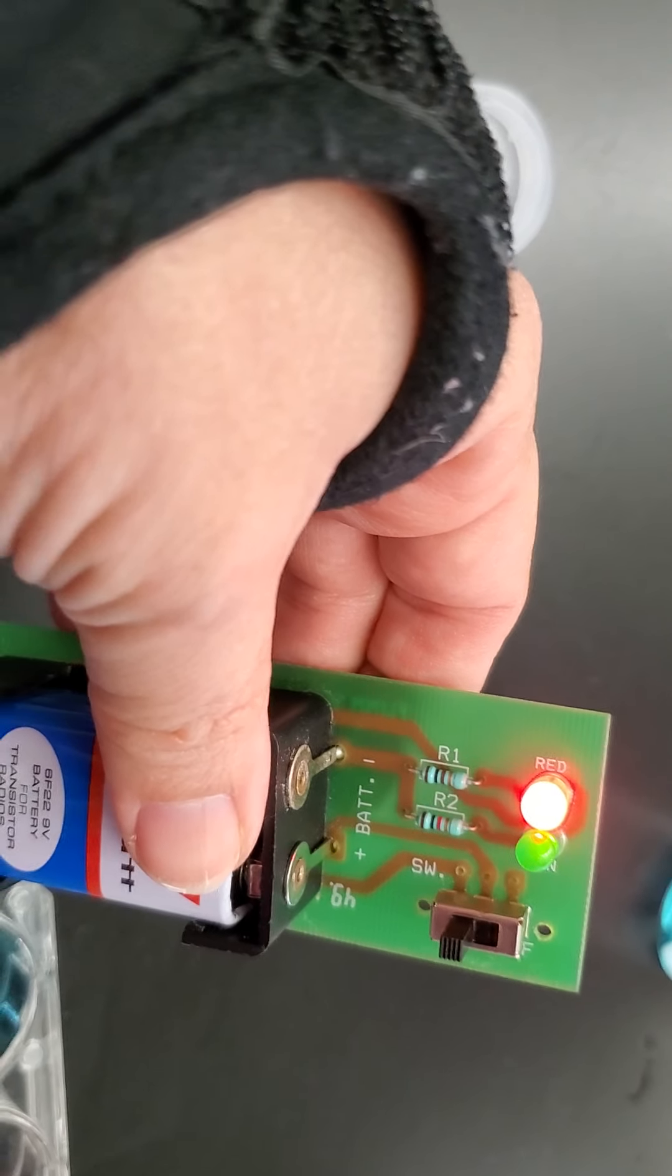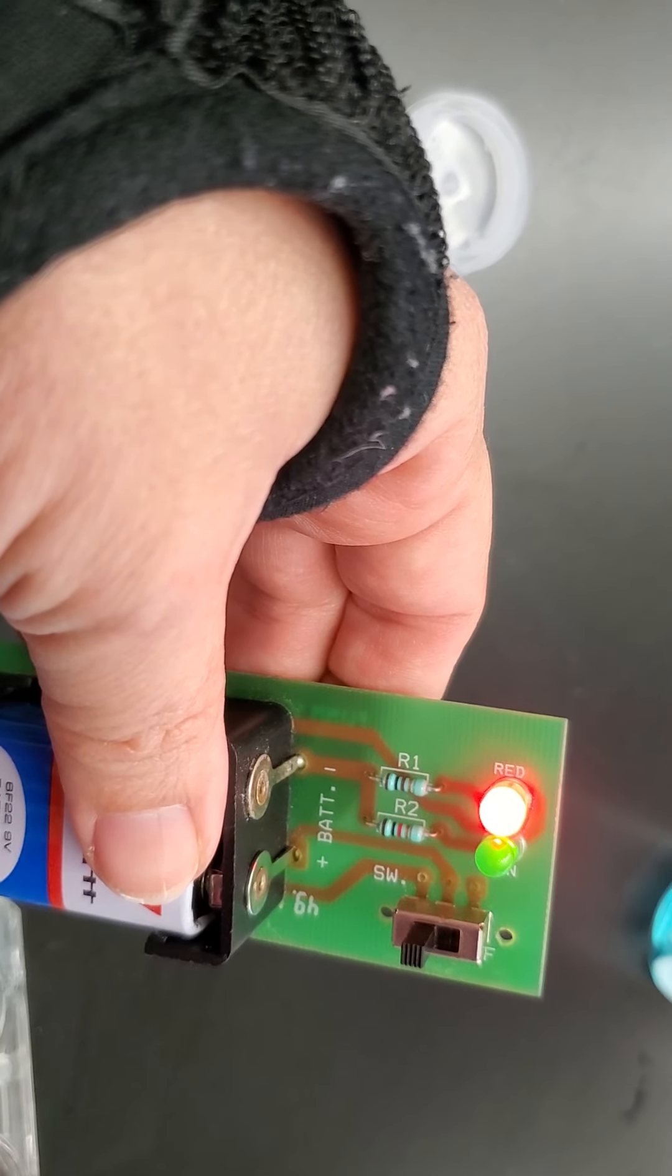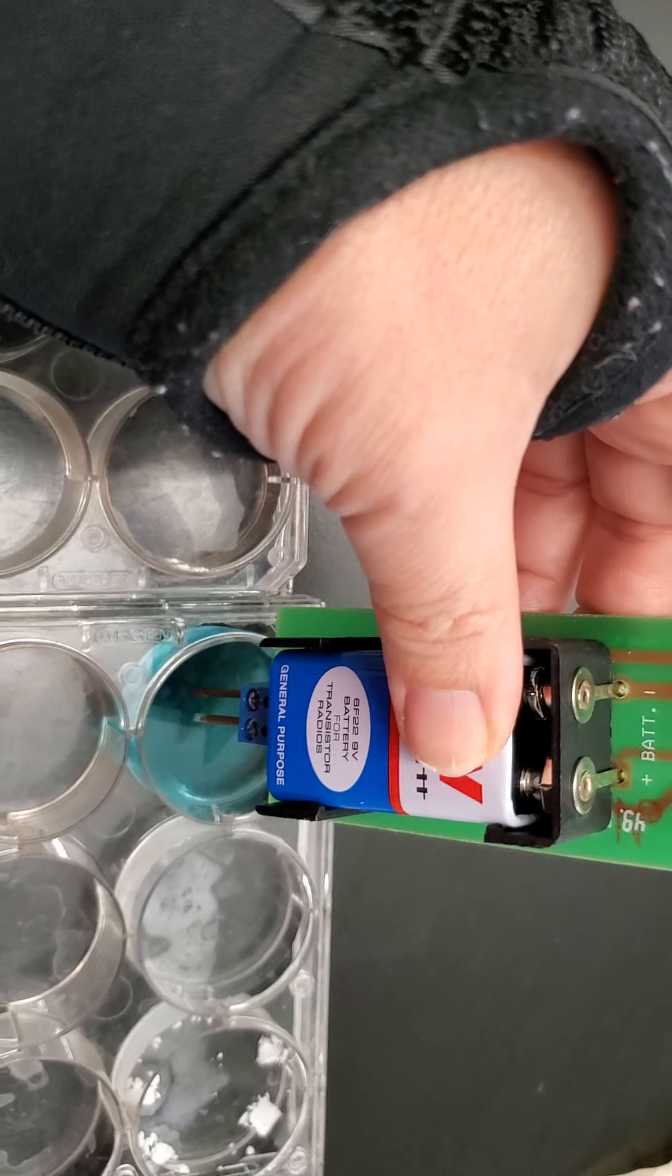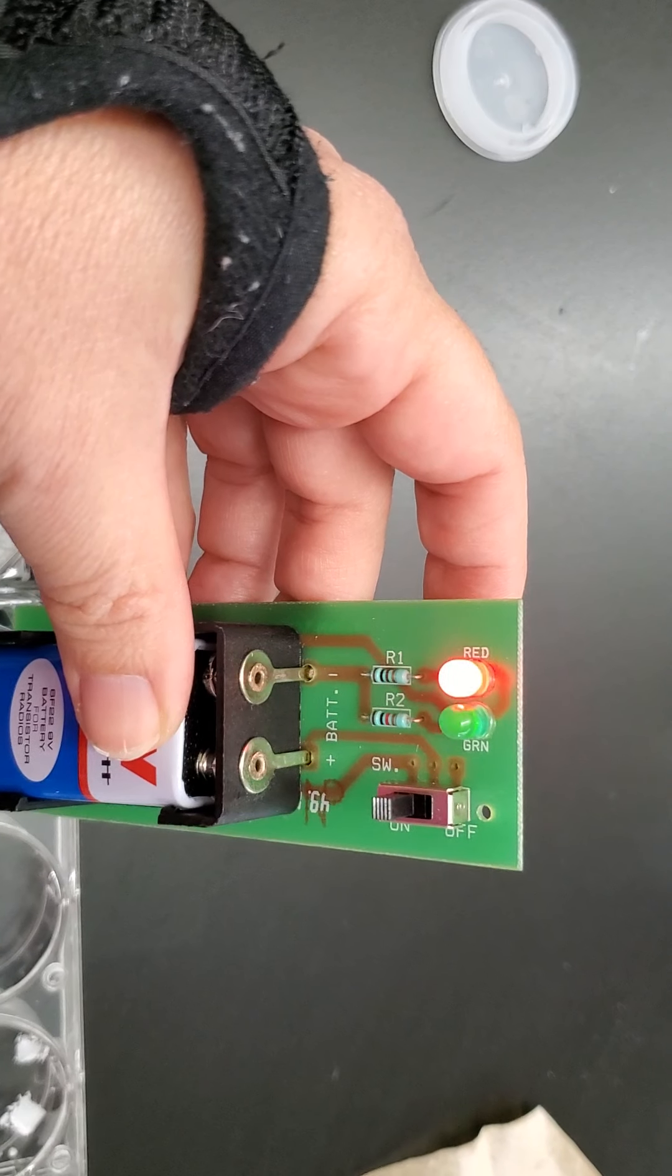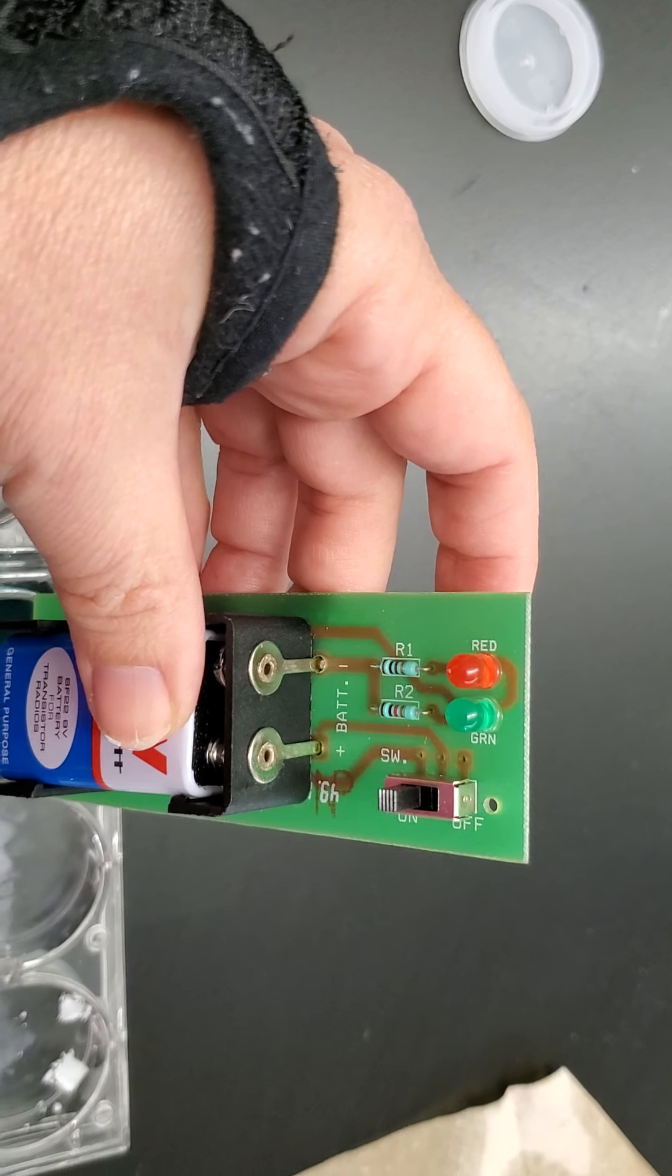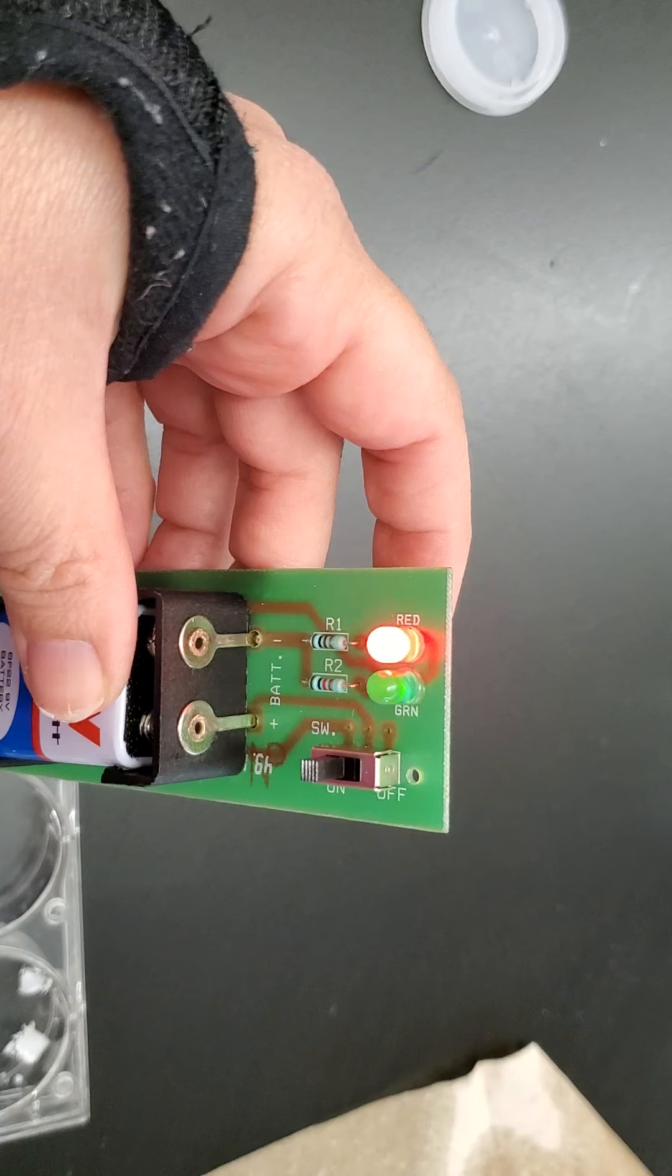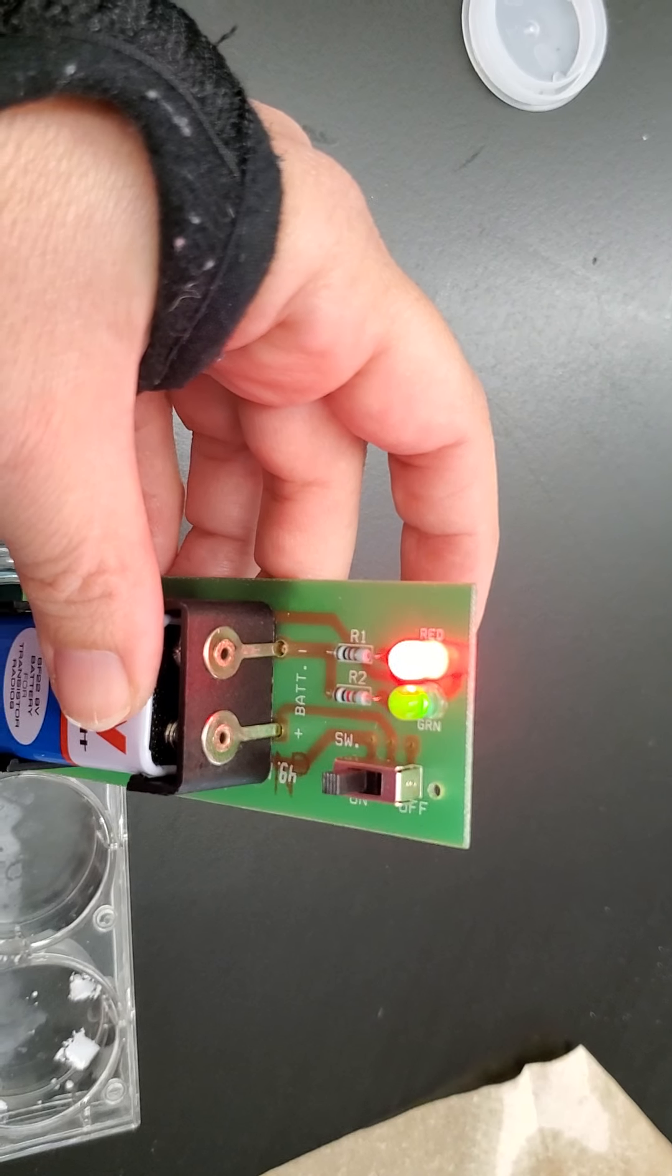We're testing number four. You can see the red one is extremely bright again. The green one is on—it's actually getting really bright.